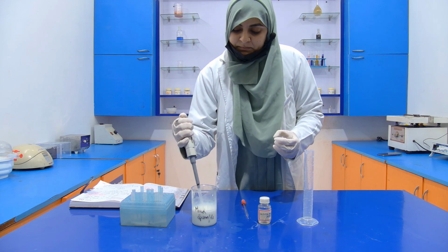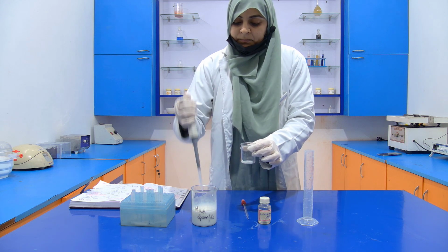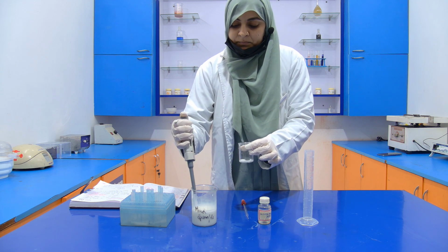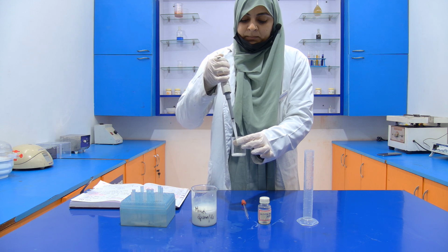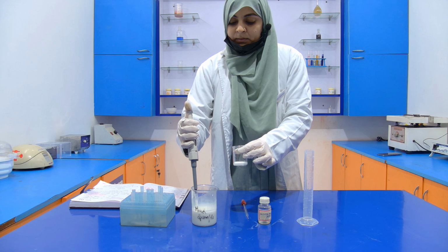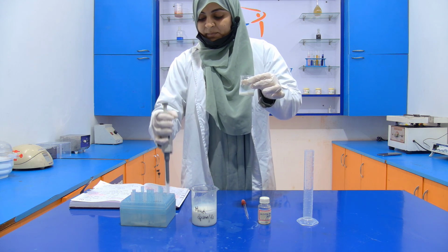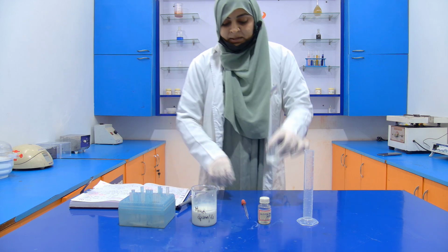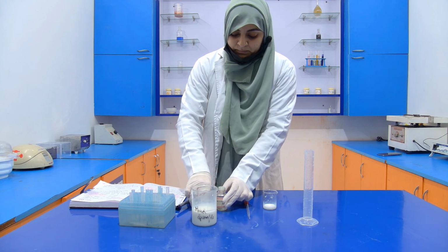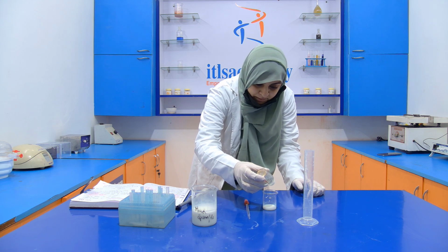Okay, 1, 2, 3, 4, and this is your 5. Okay, so I take a 5 ml sample in a beaker. Now open this concentrated HNO3. Now drop by drop I am going to add it into our sample.